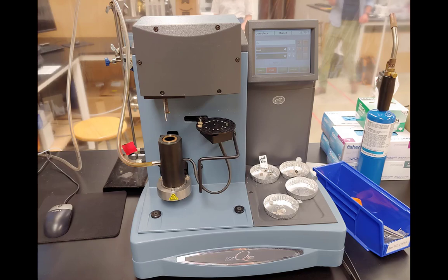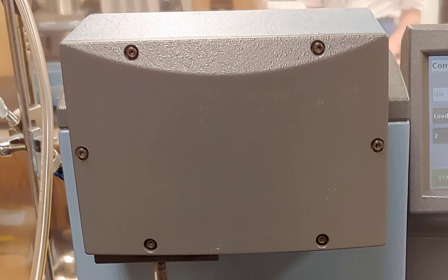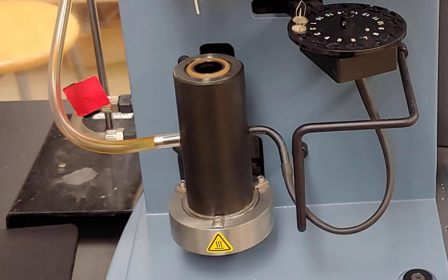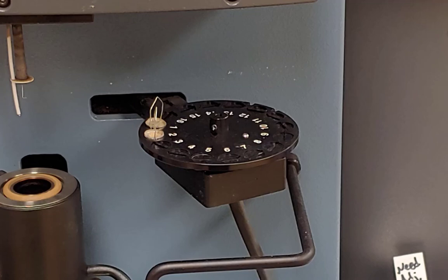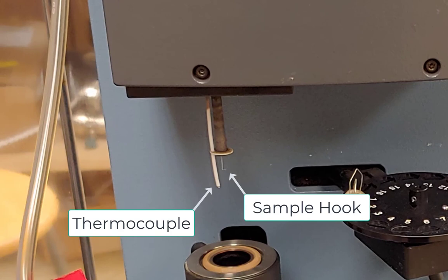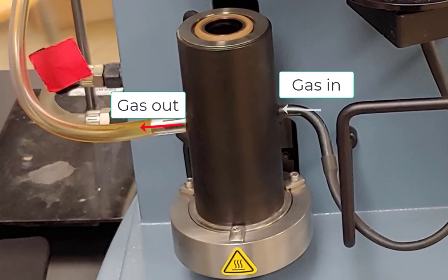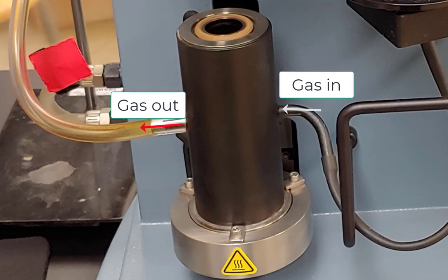Now we're going to take a look at the hardware of the instrument. This is the front view. There are a few basic parts: up top we have the actual balance unit concealed behind the front plate. Down here we have the furnace, which is where the sample is heated — the furnace raises up and down. Over here we have the autosampler where the sample pans are loaded in preparation for running. We also have the sample hook and thermocouple for grabbing the pans and measuring the temperature. And here we have the tubing which introduces the purge gas, with the tube on the other side being where the gas exits to the exhaust.